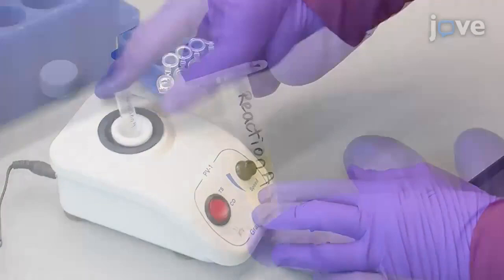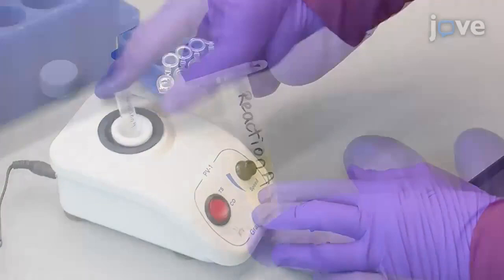Observe the reaction mixture often for 5 minutes and note any colorimetric changes of the solution.